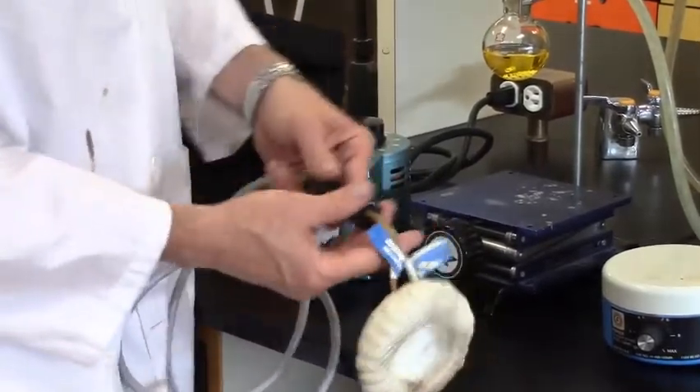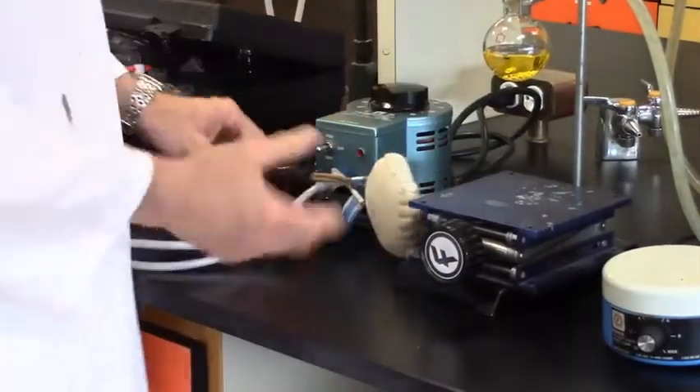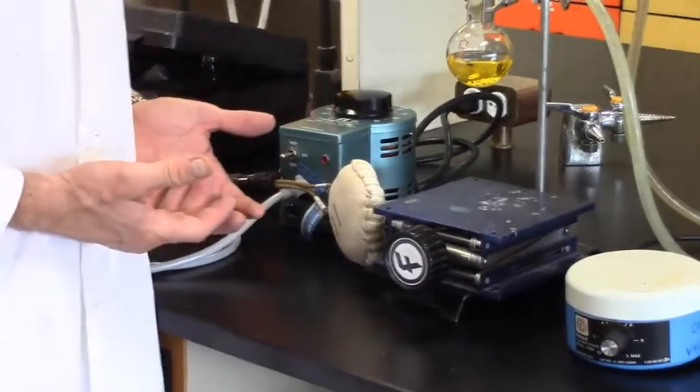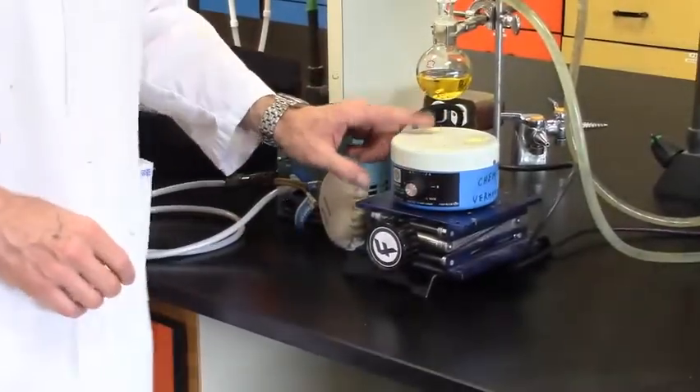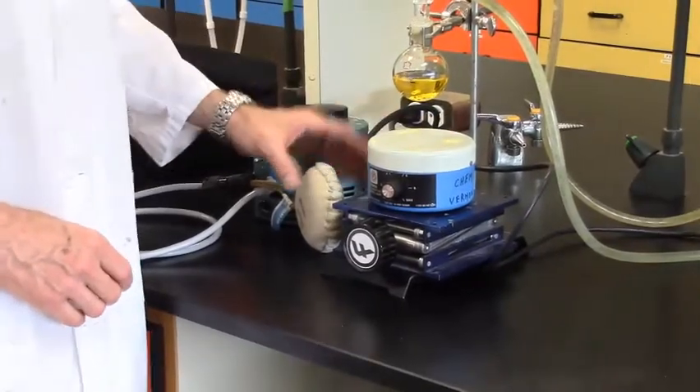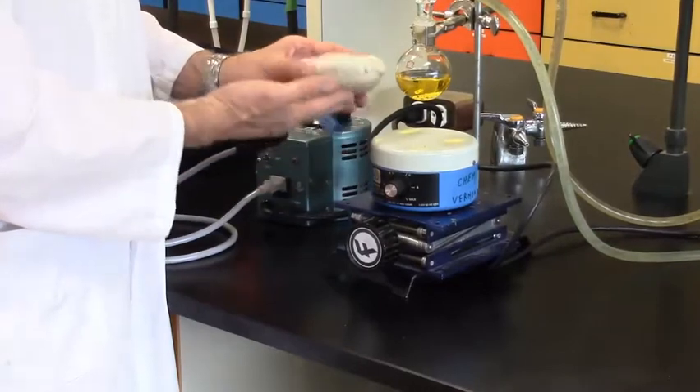Inserted and clicked — it's ready to go. I will continue to stir my solution during this reflux, so I'm going to use the stirrer. This particular stirrer has a metal lid or metal cap on it, and it does a very good job of resisting any heat buildup from the bottom of the heating mantle.